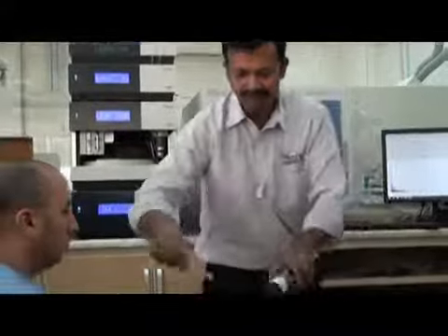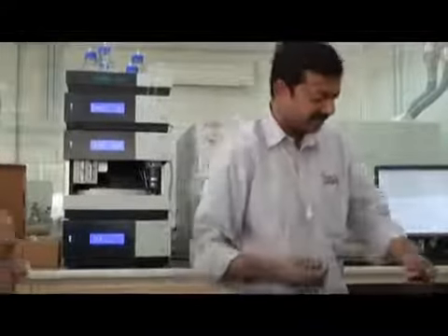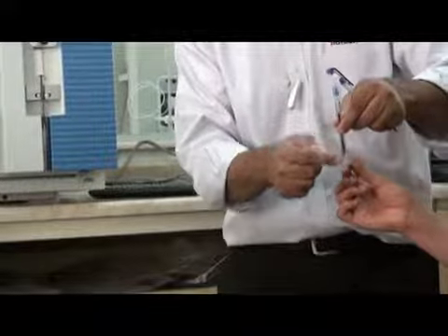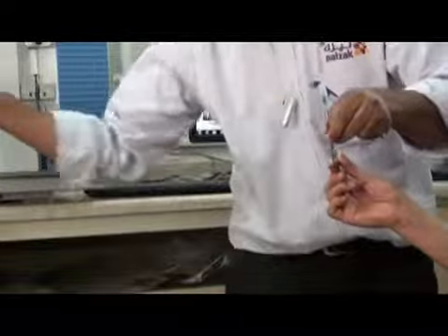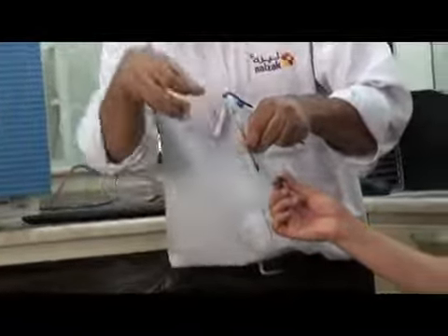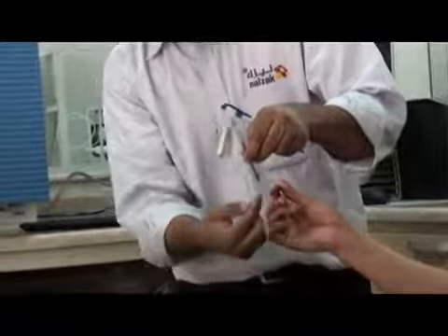Give me your pen. Hold it. This is your capillary, which you see here, the cone going inside. This is your source. Now ESI: the liquid is coming from here and the high voltage is here, because the high voltage is coming on the tip itself. This is the position now. The liquid will come, gas will come, it will spray, and some of the spray will come here.